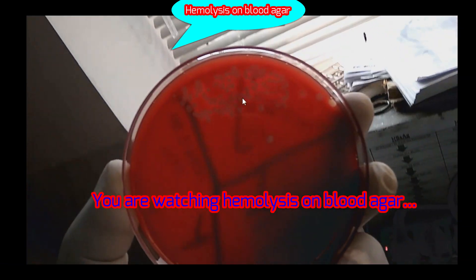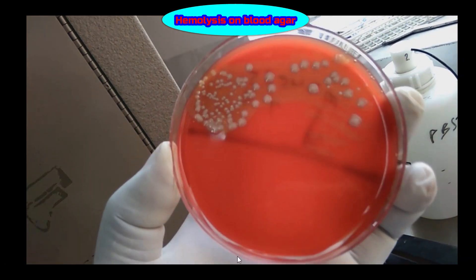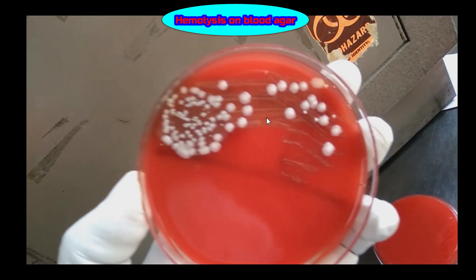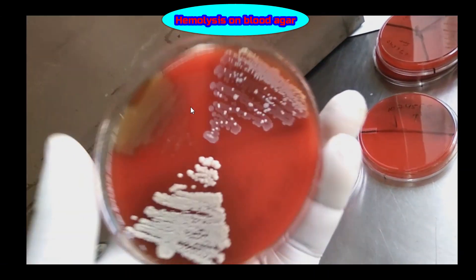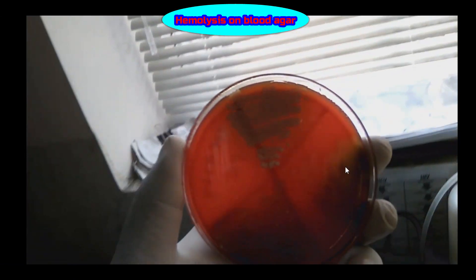Here you can see — for better presentation, let's look at another plate. Here you can see two types of colonies: one is large colonies and another is small, pinpoint colonies. Here you can see a greenish discoloration around the colonies, indicating alpha hemolytic colonies.